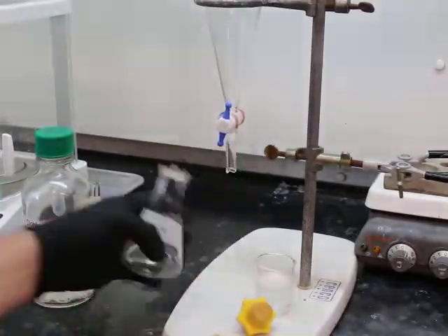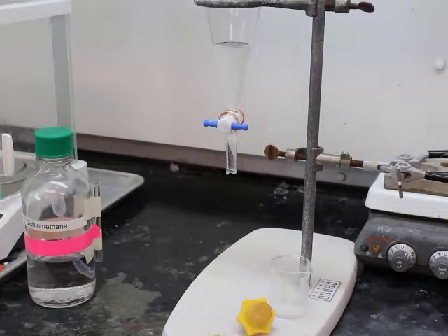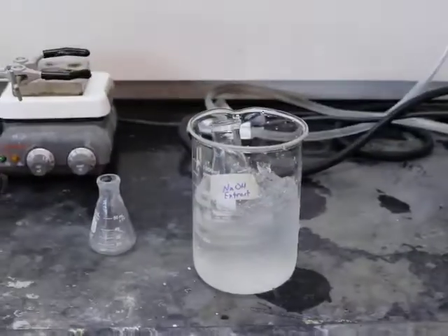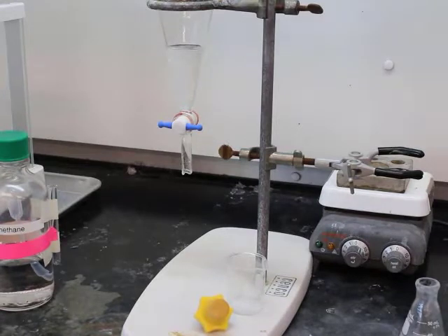Alright, so in essence, remember we added a base, so that organic layer should possess our basic compounds or our neutral compounds if they're present. And so the basic layer, the aqueous layer that we took off, that would have our acids in it if we had an acid. Okay, so added the organic layer back. We have that sodium hydroxide extract layer chilling in an ice bath per our instructions.